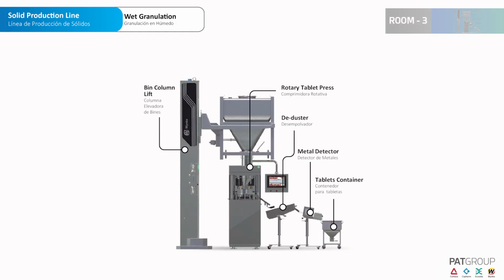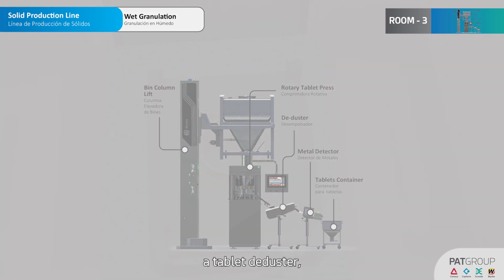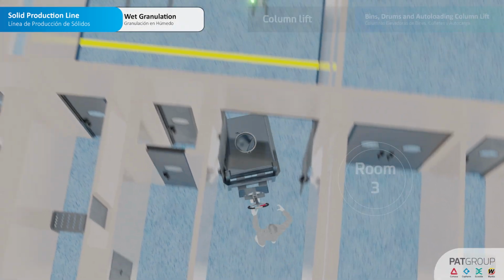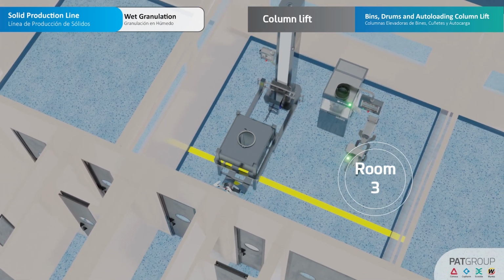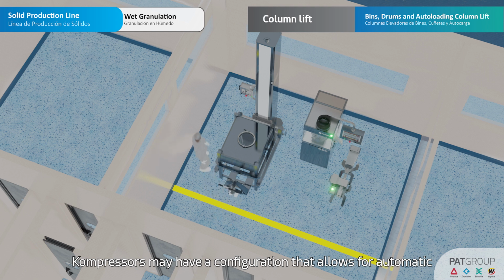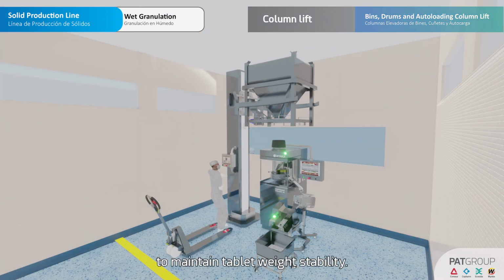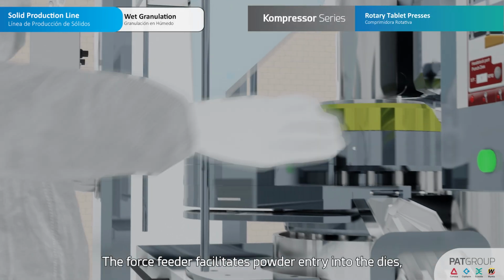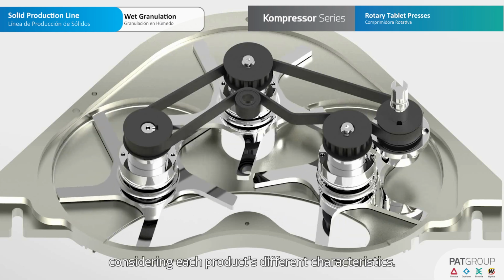Compression. In Room 3, there is a bin lifting column, a compressor, a tablet deduster, and a metal detector. The column automatically feeds the compressor's loading hopper. Compressors may have a configuration that allows for automatic control and regulation of the process to maintain tablet weight stability. The force feeder facilitates powder entry into the dies, considering each product's different characteristics.